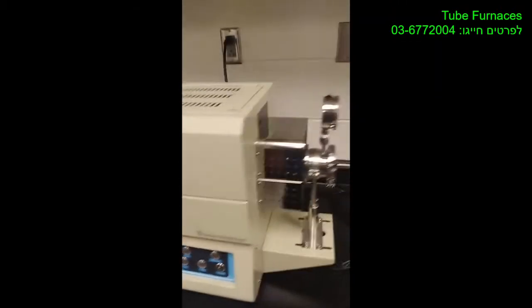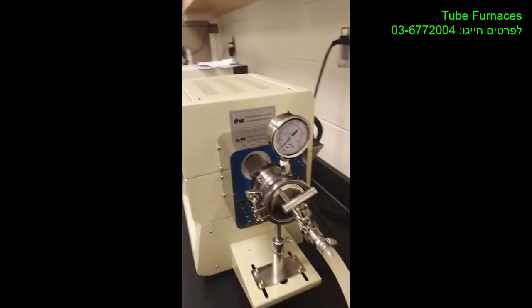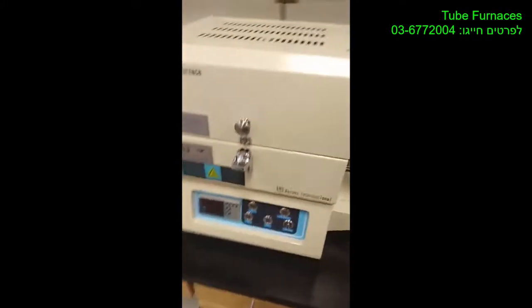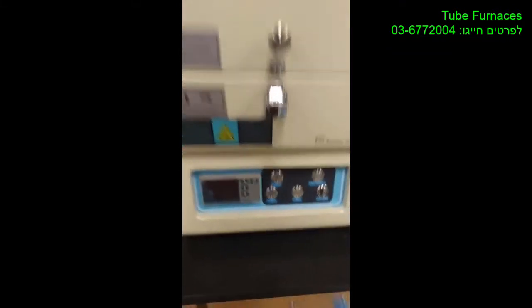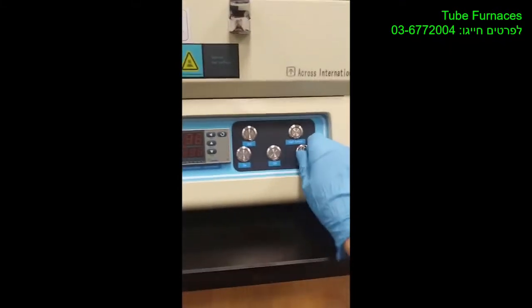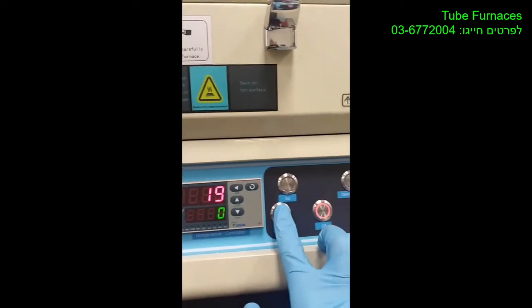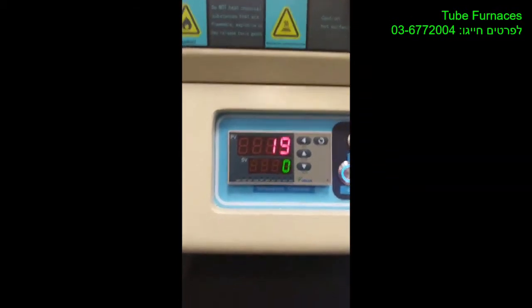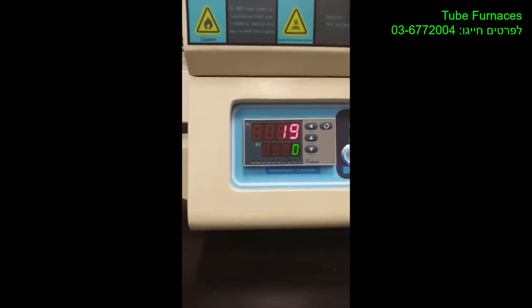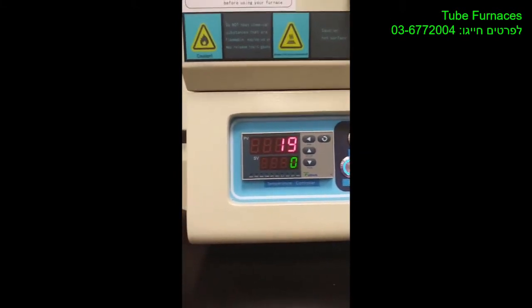In the previous video, I showed how to apply the vacuum on the tube. Now, once it's under vacuum and you need to start heating the furnace to a certain program, you start by turning on the switch and hitting on. And now we want to apply the program, the temperature and time to get to those temperature steps.